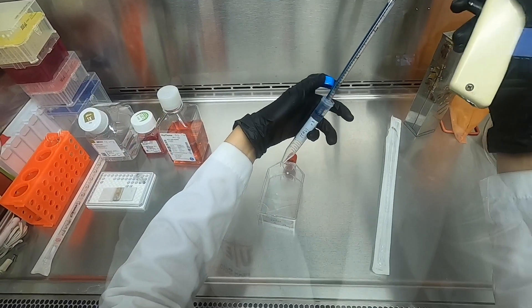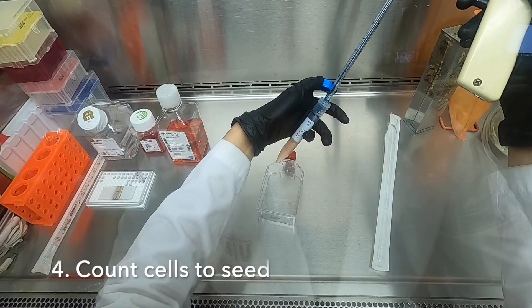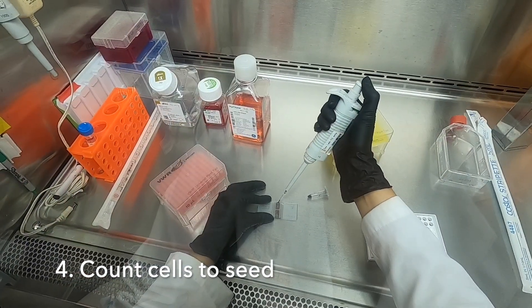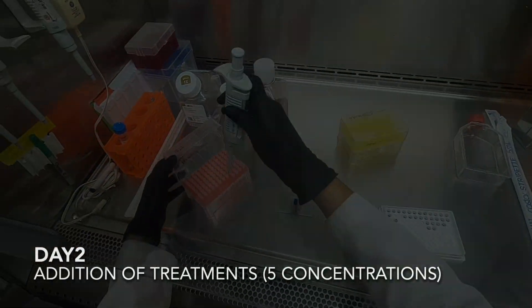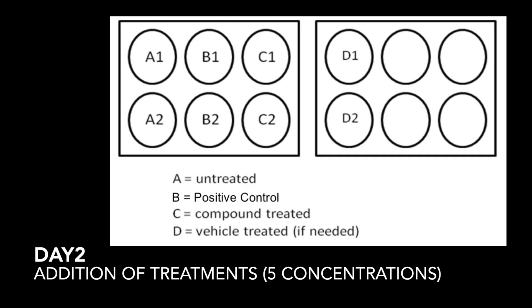Finally, we count our cells using trypan blue exclusion method as described in our previous video. We can then seed the appropriate number of cells and incubate the plate in order to allow the cells to attach. During day two, we will be adding our compound and control treatments.